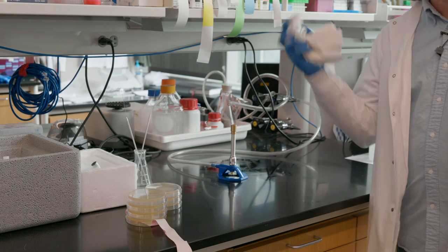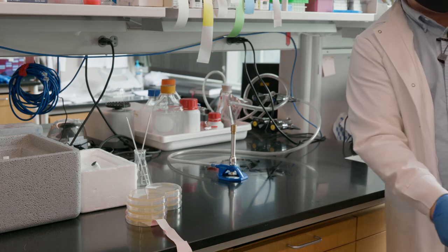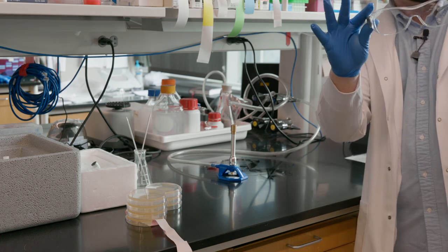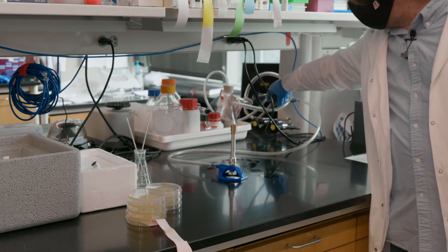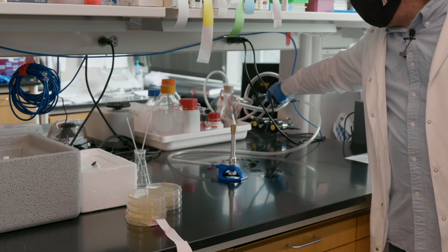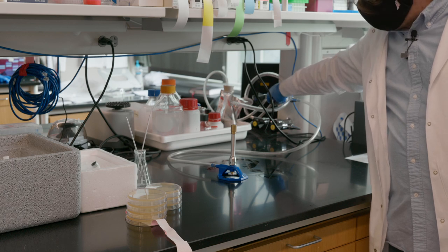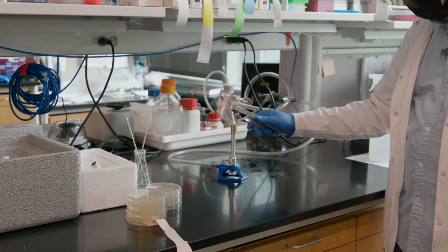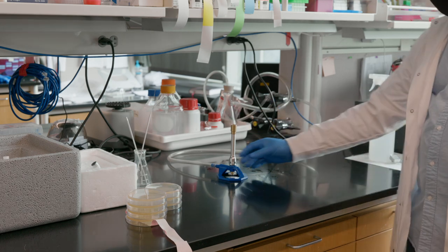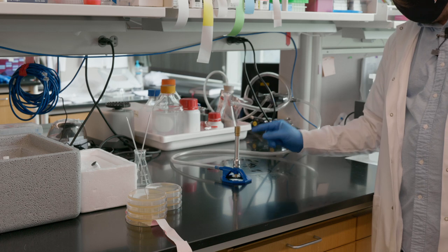All right, now in turning on the Bunsen burner, it's always important to have your safety glasses. Start. You want to be able to hear this hiss before you light it, you know the gas is flowing. And this is the level of flame you want. It's nice and blue.